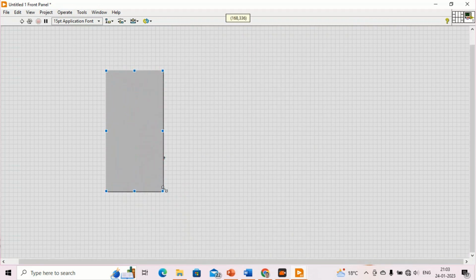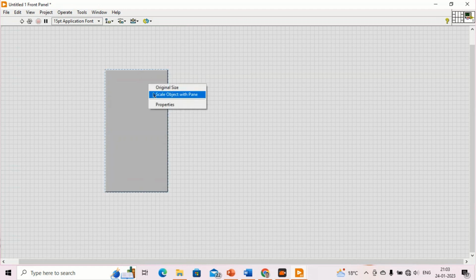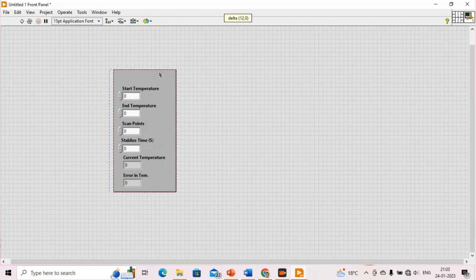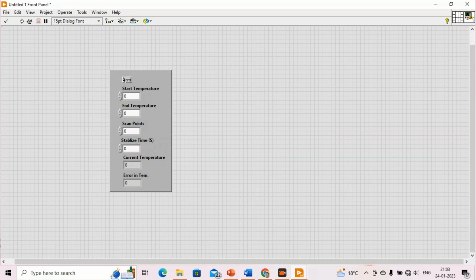It is good practice to decorate your interface. So this is the temperature controller.